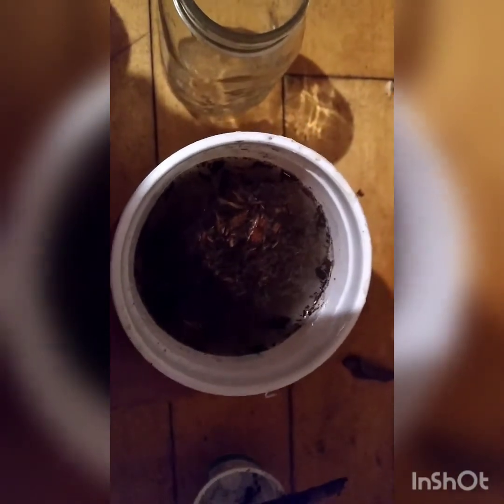It's been more than two minutes, and so now the spores have floated to the top, along with unfortunately some bits of random things. That's alright. What we're going to do is carefully pour off the top of the liquid into the glass container — I used a mason jar, so any glass container or something similar would work — just the top.